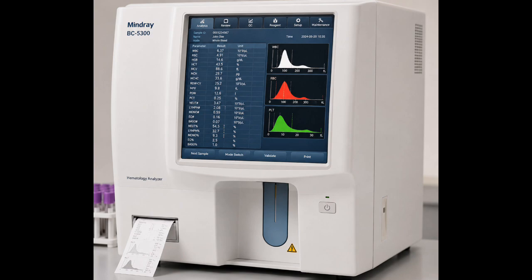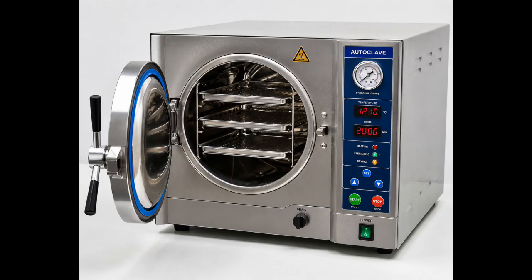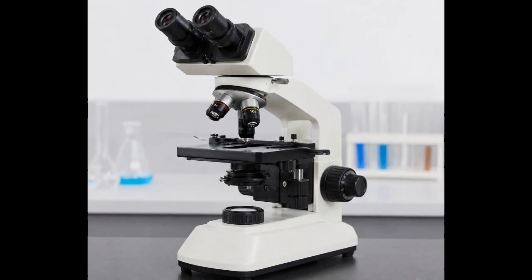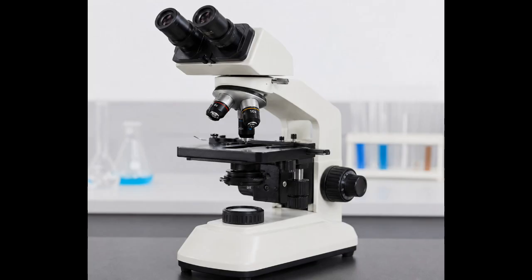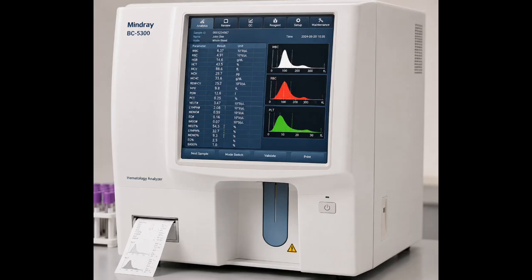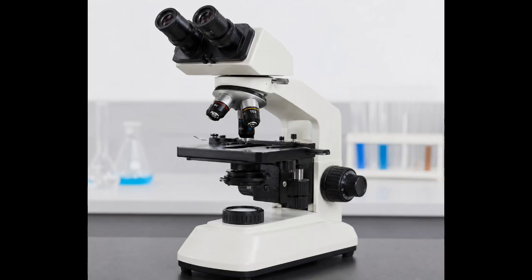In this video, we will discuss different laboratory materials one by one, explain what they are, and describe how they are used in laboratory procedures. So, stay with me until the end of the video to discover the essential materials that help medical laboratories provide accurate and reliable test results.